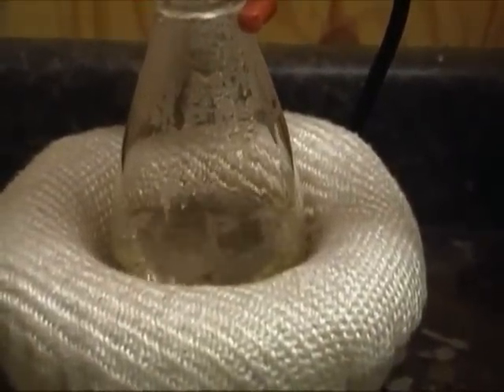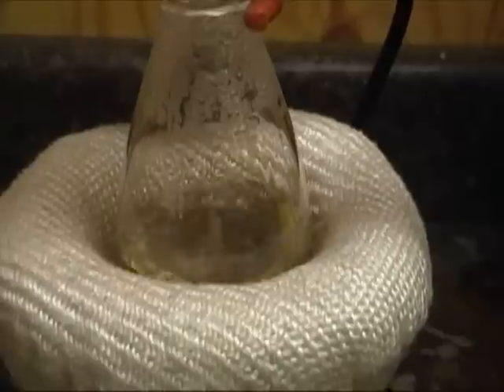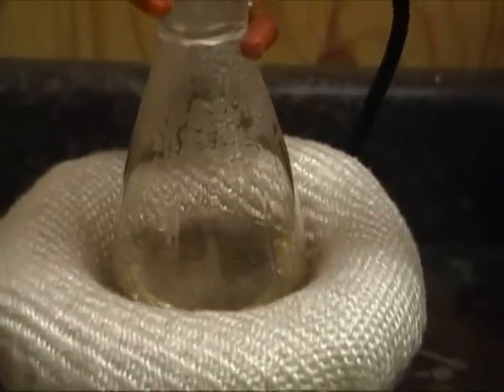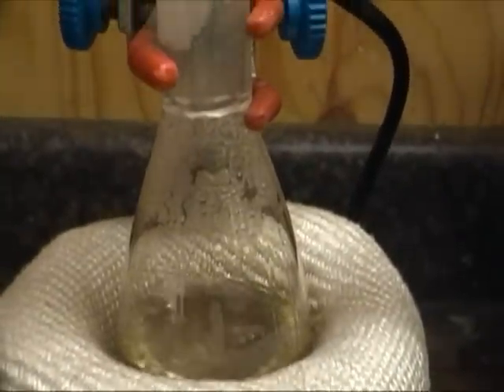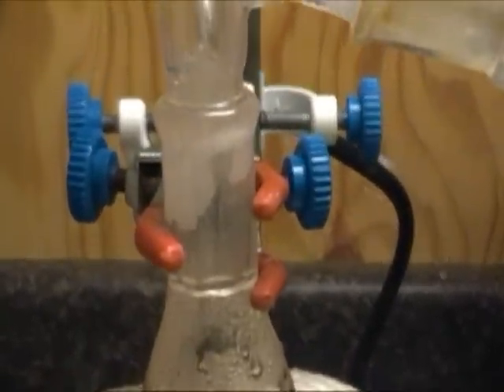We're going to need to set up for a simple distillation. It's boiling here — you'll see a product coming over at about 83 degrees C.